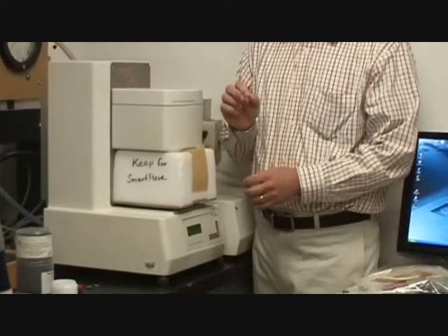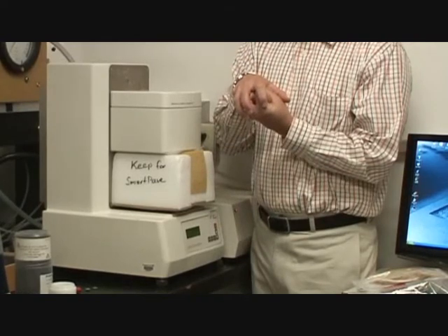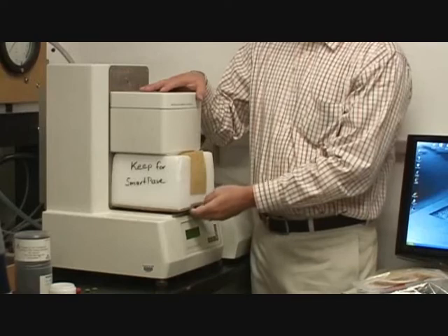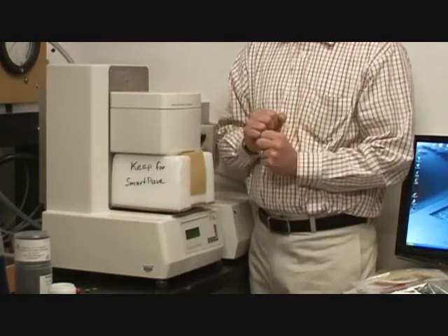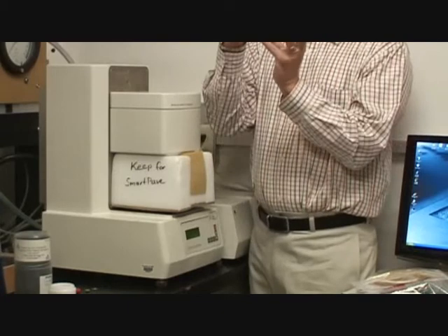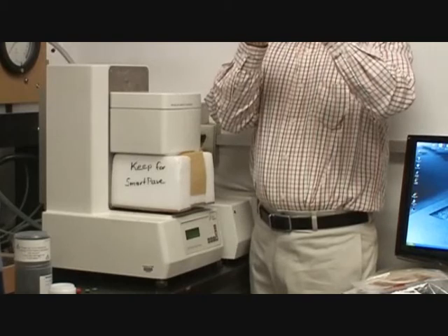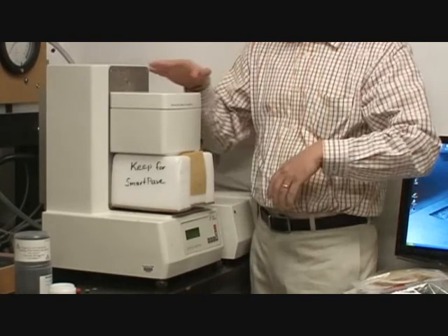You hear that click, it stops, right? So what it's done is it's pushed in and now it's isolating that bearing so it won't rotate. So that's a nice safe way to store it. You could do it with the Peltier plate in there, but it's kind of bending that bottom cardboard. So what it's doing is preventing that from turning. It's also lifting up just slightly. This is a micron gap here, so it's also protecting it, locking it in place.